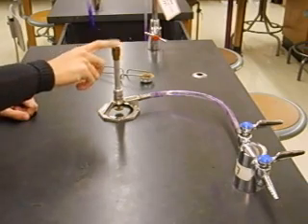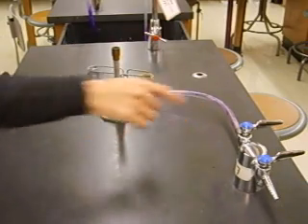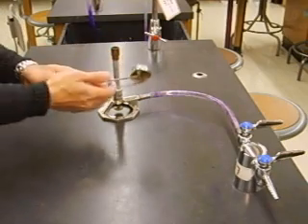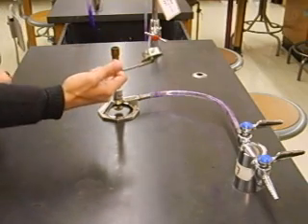You're going to need your Bunsen burner and the tube that connects it to the gas outlet. These two things can be found in the cupboards underneath your drawers. You're also going to need the striker, and the striker can be found in your drawer.